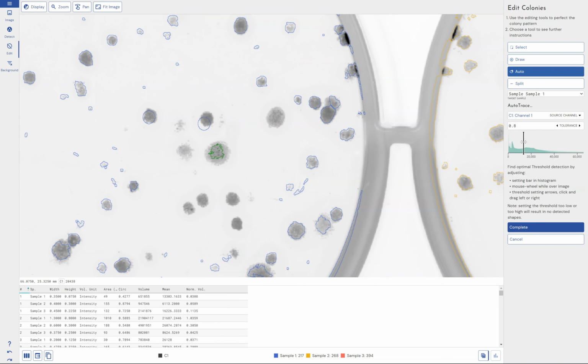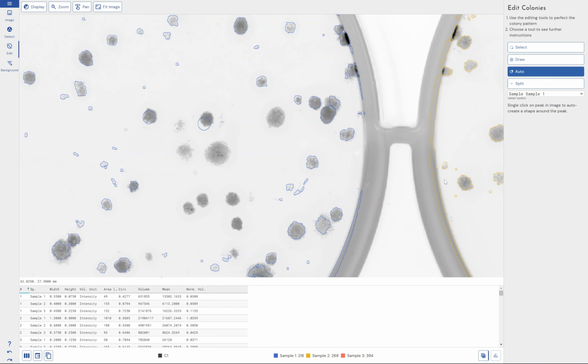And I can change the tolerance level of this automatic detection again to wrap around my spot. And you'll see that you can combine the automatic spot detection and the manual spot detection if you so wish. So it's not one or the other. You can use the automatic detection to get you 80-90% of the way and fill in the rest manually. We support both modes, together.